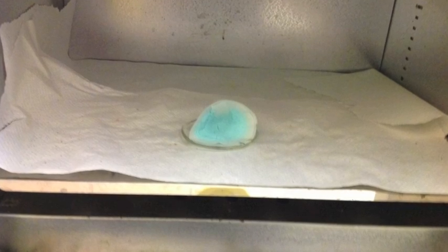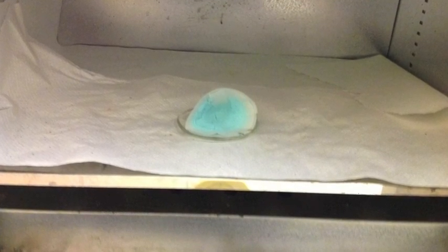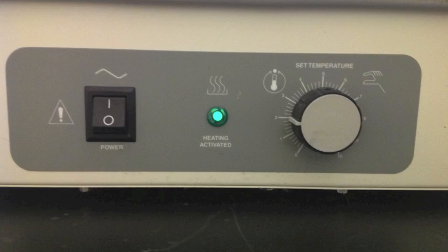I'm going to speed things up by putting it in an incubator. Just lay the filter paper on the watch glass and place it in the incubator, making sure the door is closed. Make sure it's set to a low temperature — you don't want it all the way up to 10, or you'll set fire to the material inside.